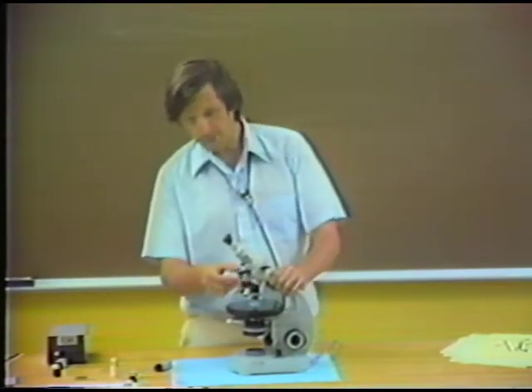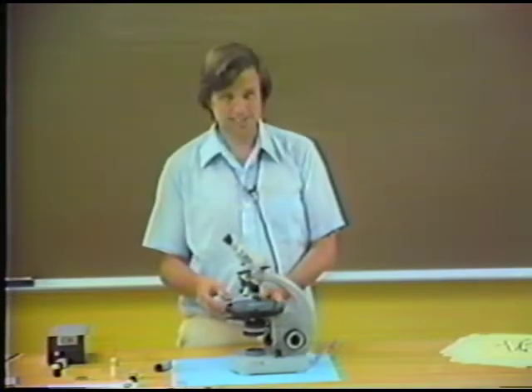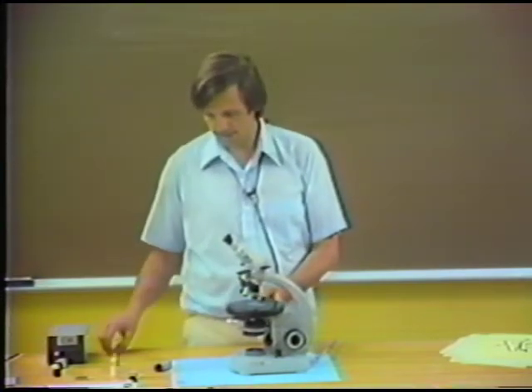We'll again apply the oblique illumination test on this particular mineral. And as we look at the mineral grains, I think you can see now, even though we have the same refractive index as before, 1.490 as listed on the bottle, the heat has actually lowered the refractive index of the liquid, and now we see a yellow color fringe that indicates that the crystal is slightly high.